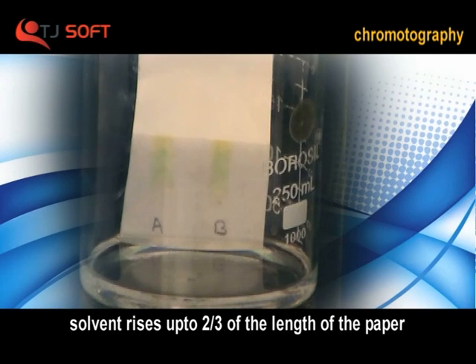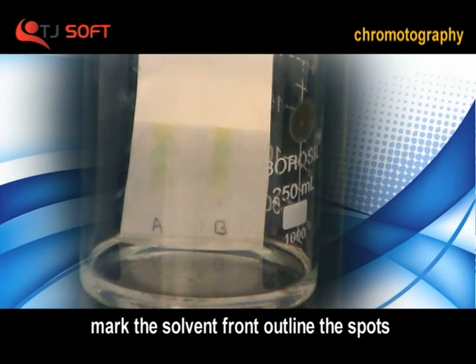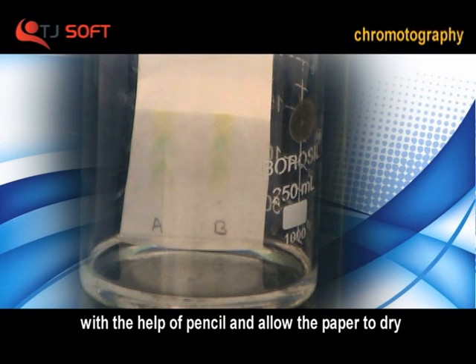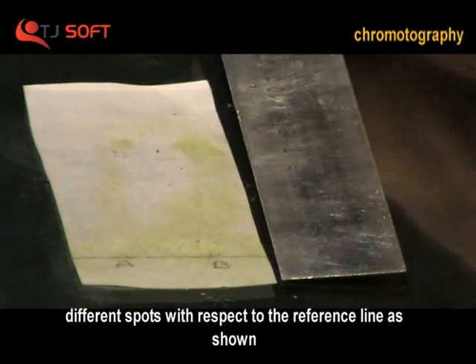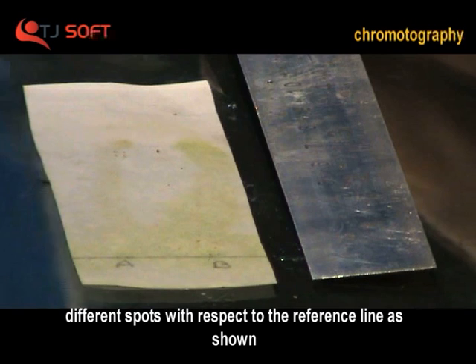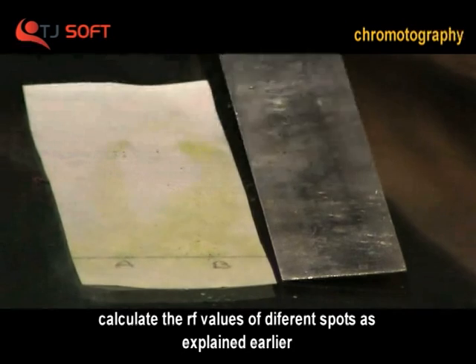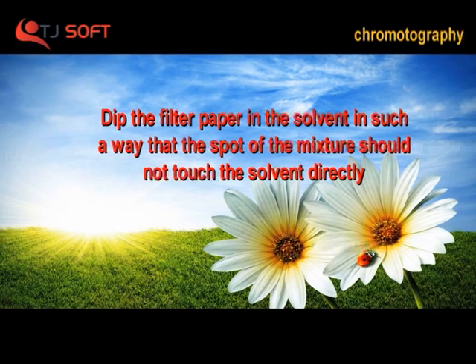Mark the solvent front. Outline the spots with the help of a pencil and allow the paper to dry. Measure the distance of the solvent and different spots with respect to the reference line. Calculate the RF values of the different spots as explained earlier.